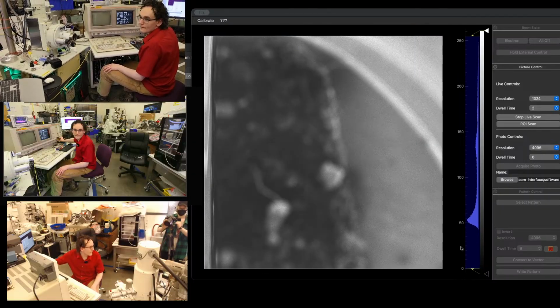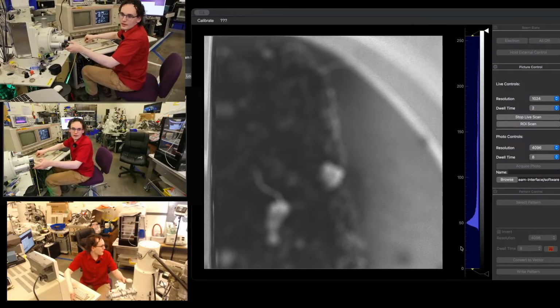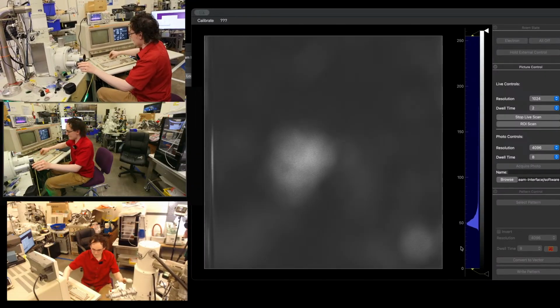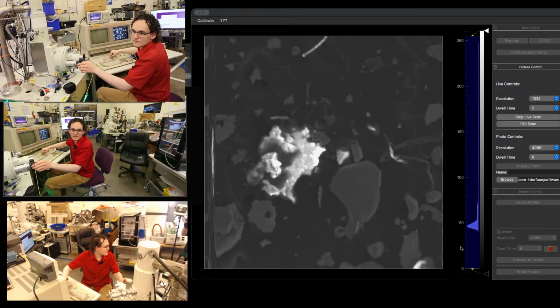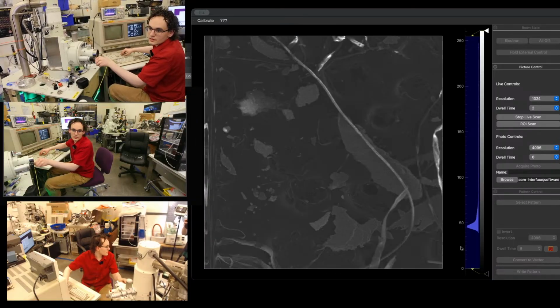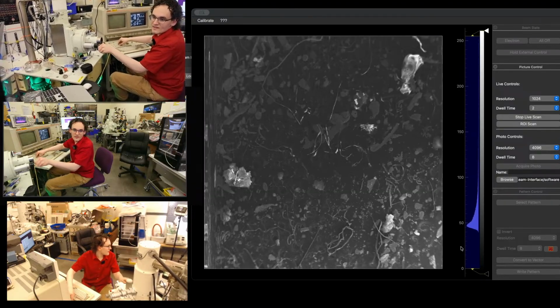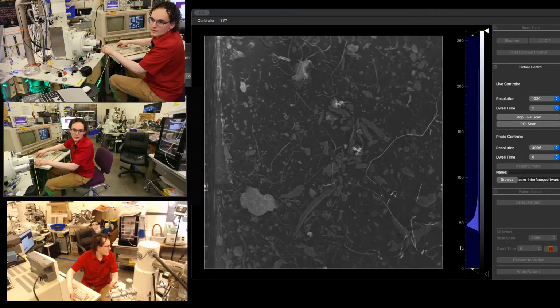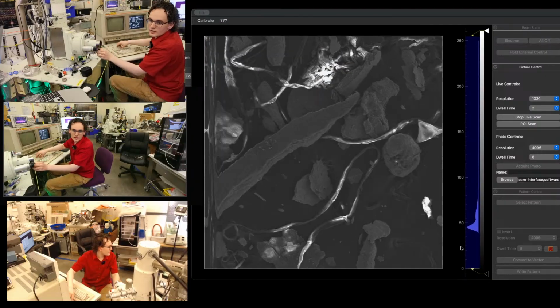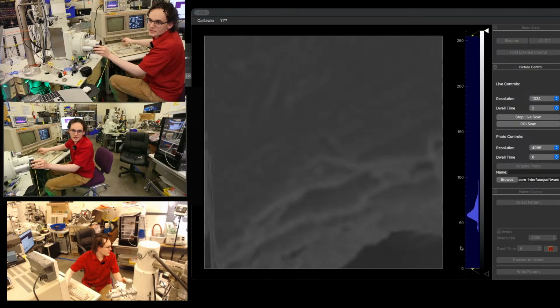So we're saturating our filament. There we go. Cool. Let's figure out what we got. Okay, I got a lot of different flakes here, so I'm guessing that that is metal, maybe? Well, let's just get the, so that's something insulating. And that appears pretty conductive, so that's probably metal right there.